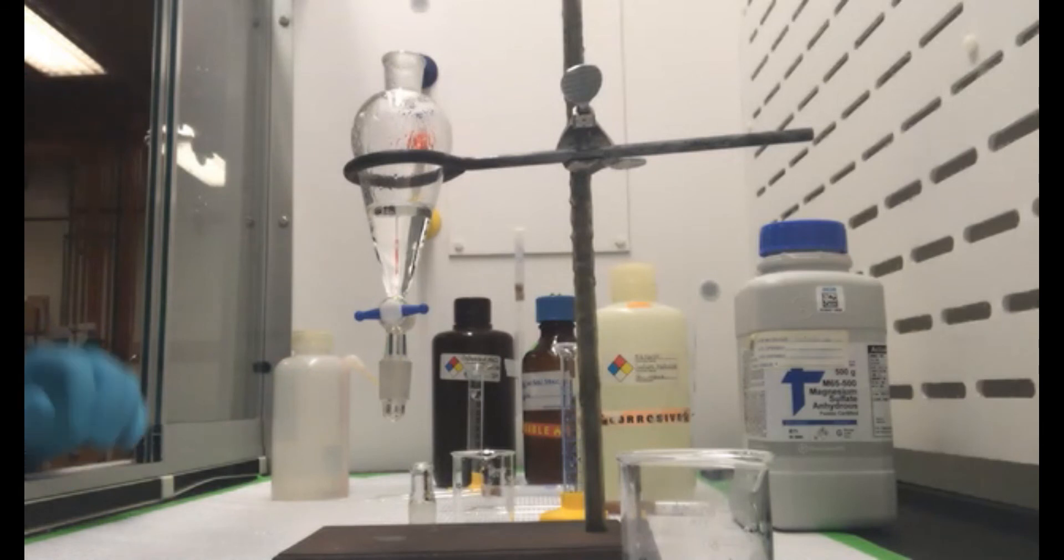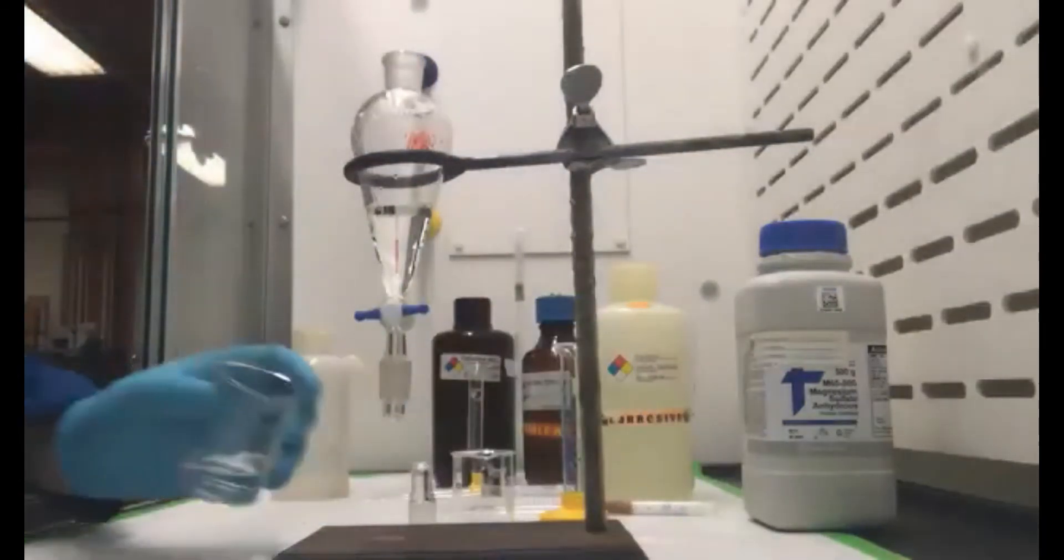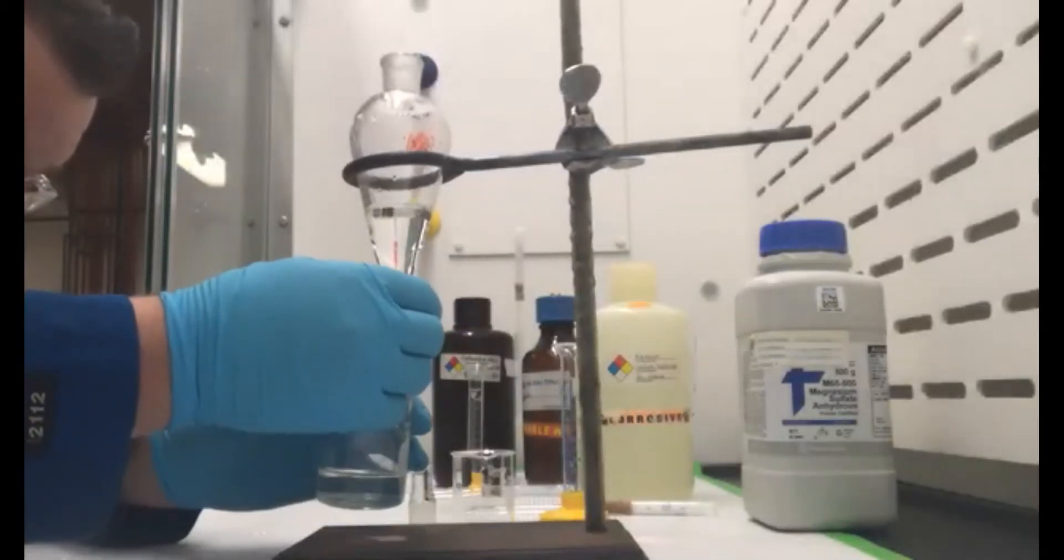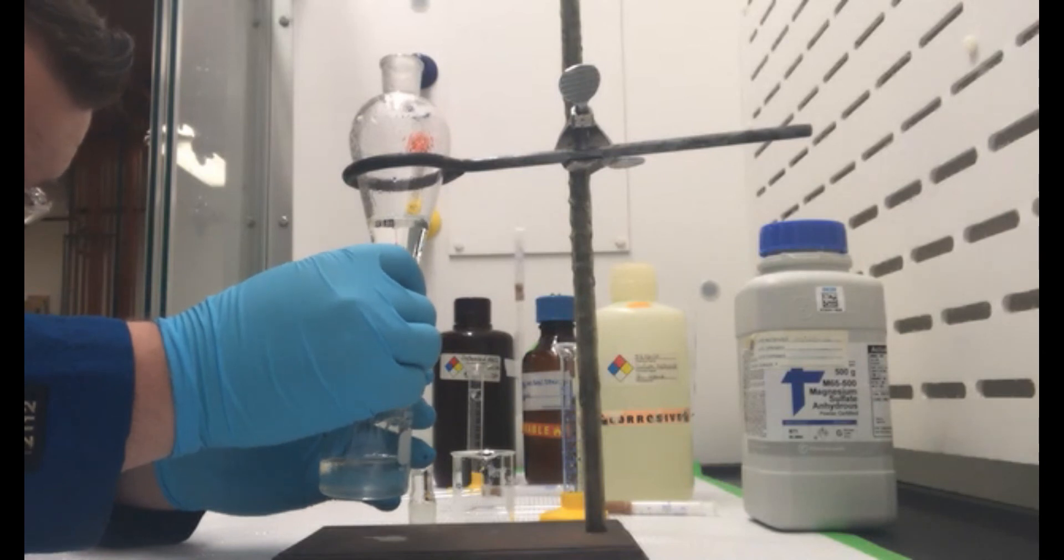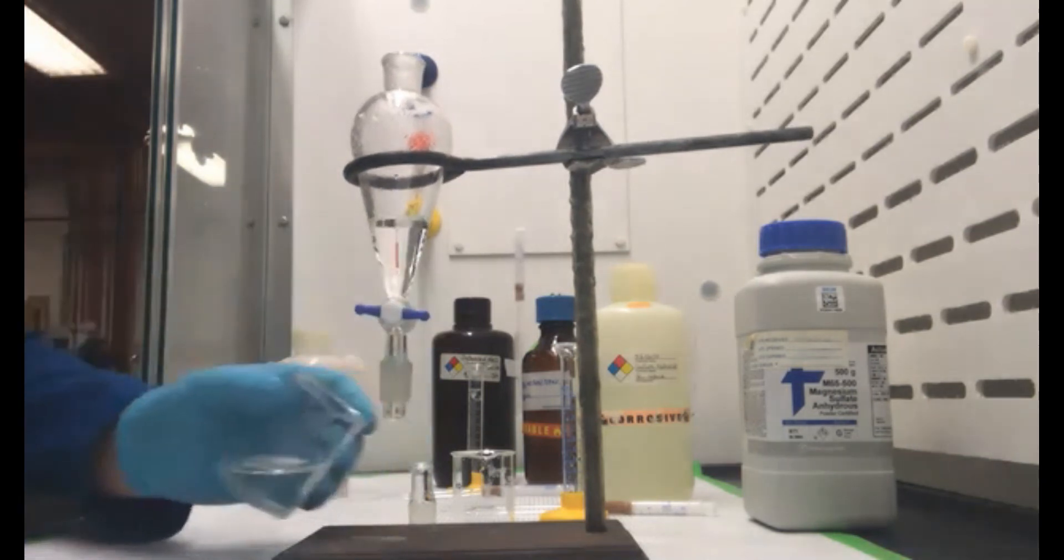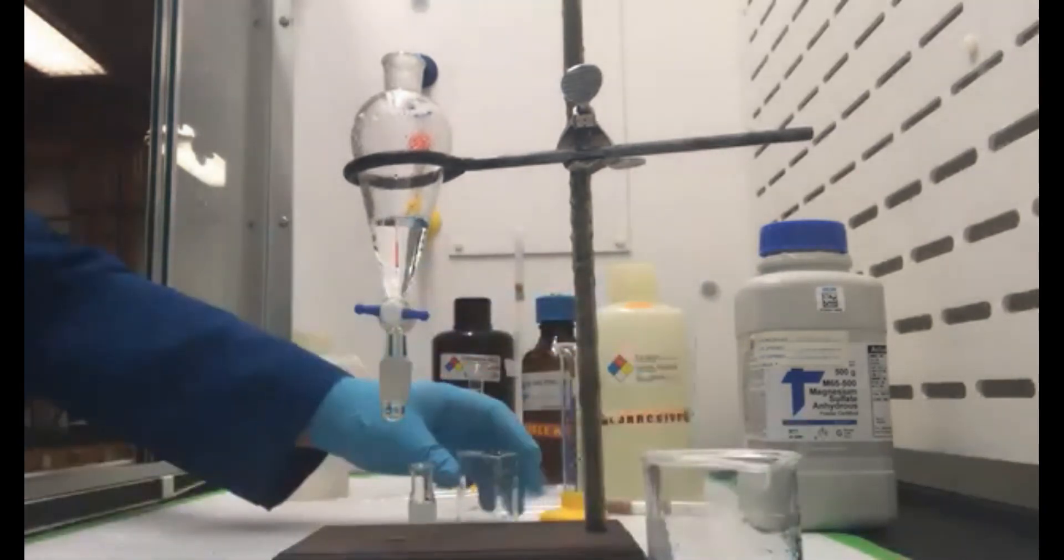I don't know if you can even really see it. You can barely see it on the camera. I'm going to go ahead and get rid of that aqueous layer and we're going to collect our organic layer.